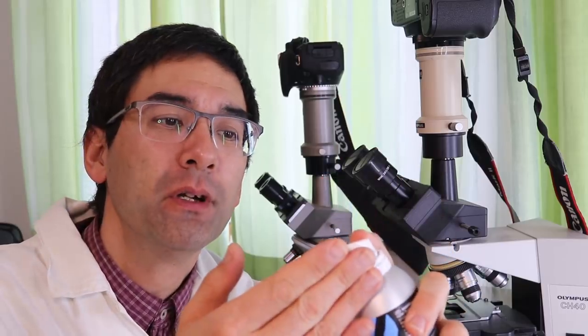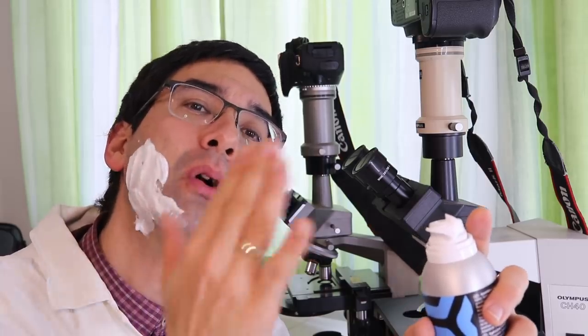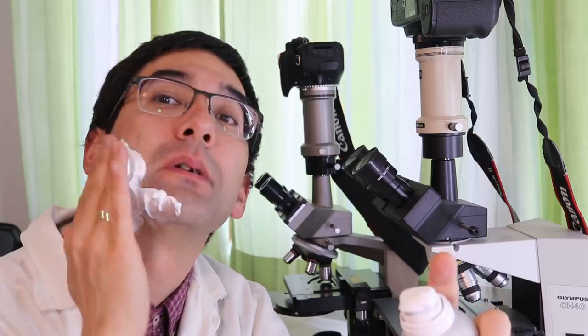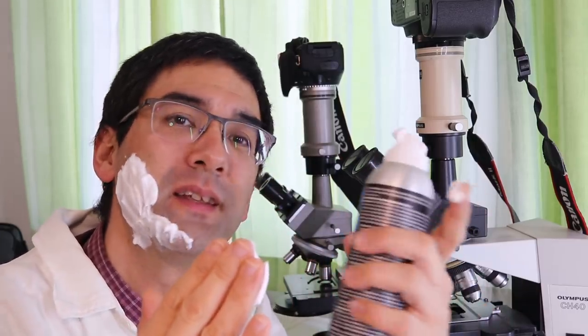I've got a bottle of shaving foam here and this shaving foam contains many, many small microscopic bubbles. And what I'm going to do today is not just put it on my face, but I'm going to put it under the microscope. And what I would like to know is how many foam bubbles are there in a bottle of shaving foam like this.